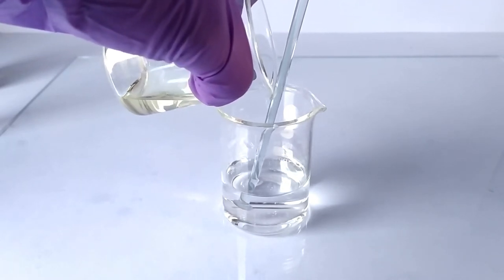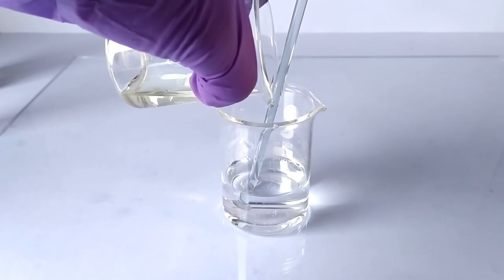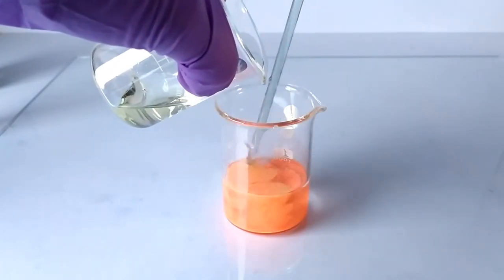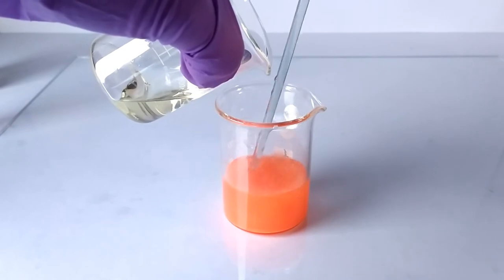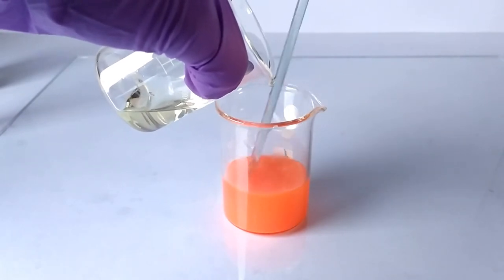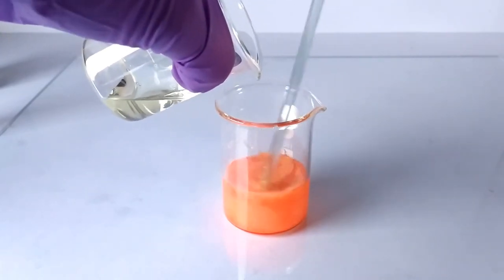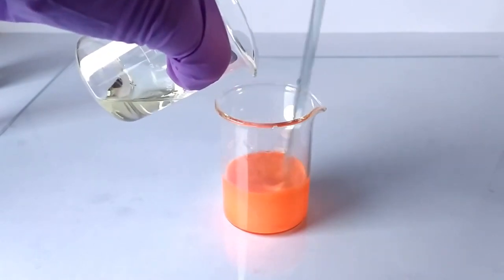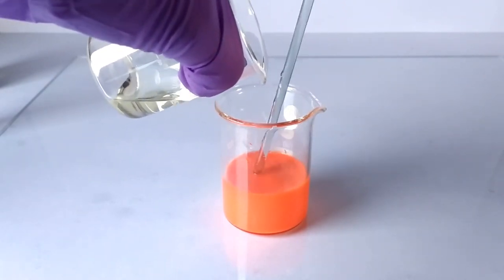Upon the addition of the iodide to the mercury salt solution, you can see a beautiful display of pinkish orange precipitates of mercury iodide as the two solutions start reacting. As more of the iodide is added, the precipitate slowly becomes thinner and scantier.